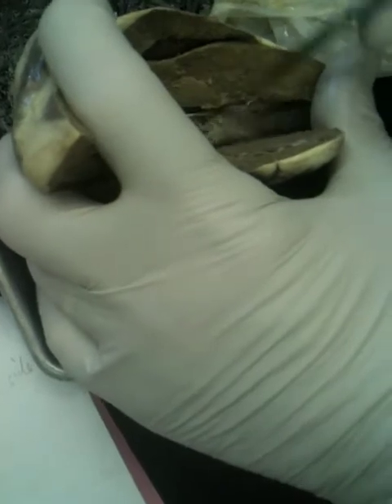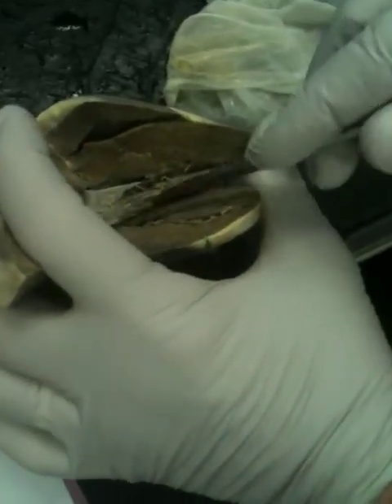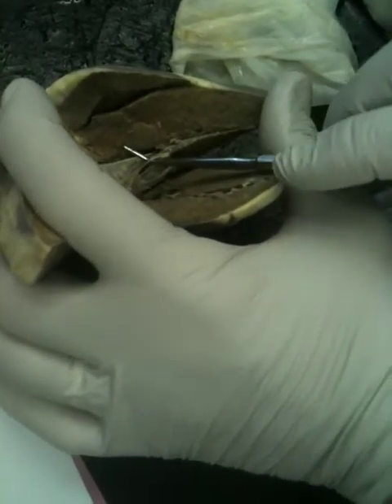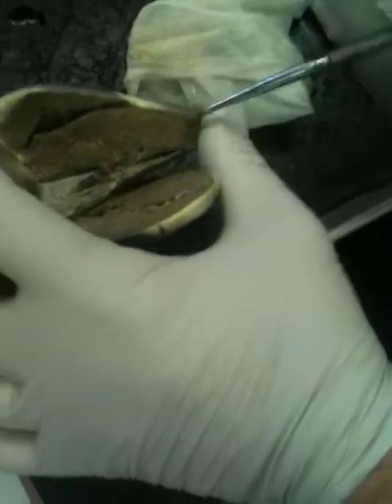What valve is this one right here? Bicuspid valve. Bicuspid or mitral valve. Or if you want, left atrioventricular valve, if you want to write all that out. What is this thing right here, this thing sticking up? That's papillary muscle. What are those little strings called? Chordae tendineae.